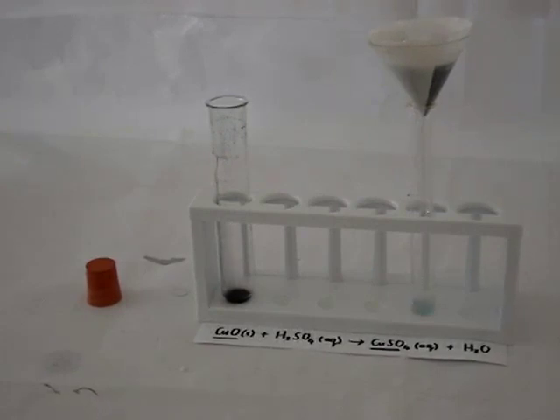showing us that indeed, the metal oxide, such as copper oxide, reacts with an acid such as sulfuric acid to form a salt and water.